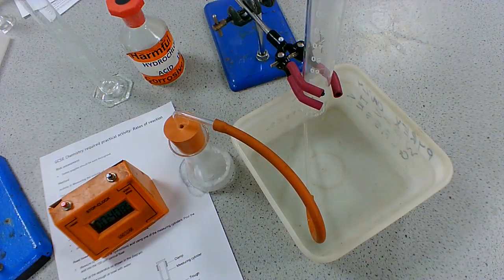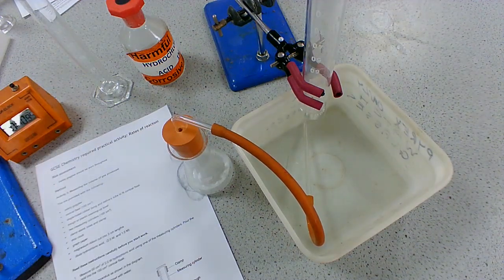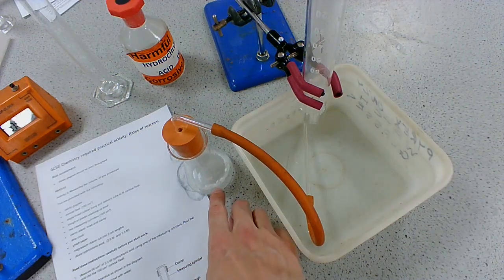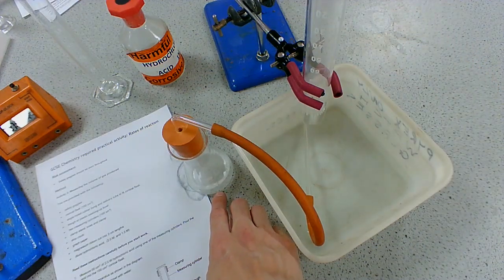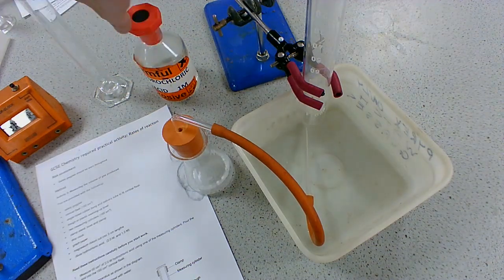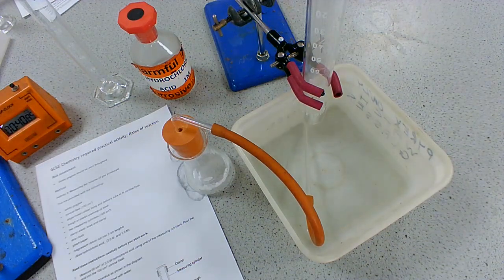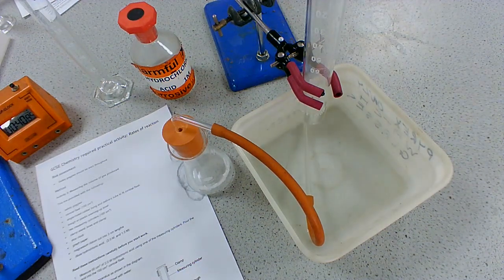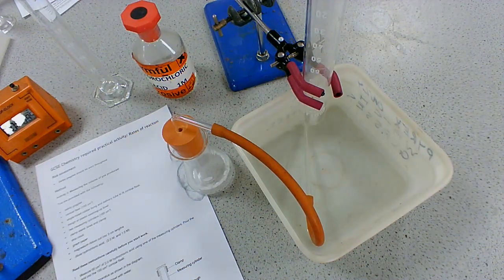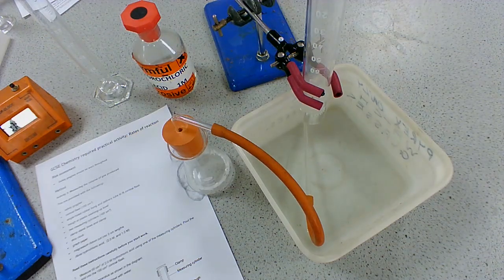In this experiment, you would then repeat this - wash it out, refill with water, using the exact same mass of magnesium, but varying the concentration of the acid. This was the 1 mol/dm³ acid, so you could do the same thing using the same mass of magnesium and same volume of hydrochloric acid, but vary the concentration - perhaps use 0.5 mol/dm³ or 2 mol/dm³ - and you would be able to see the effect that has on the rate of reaction.